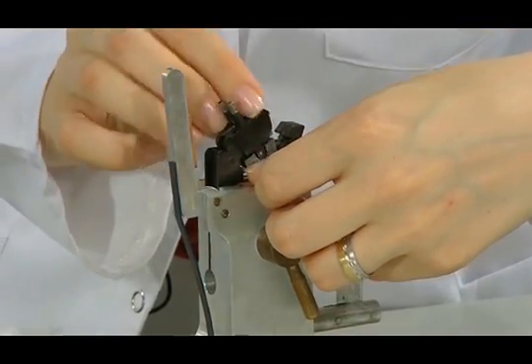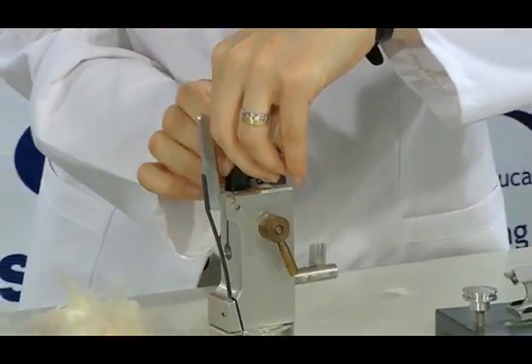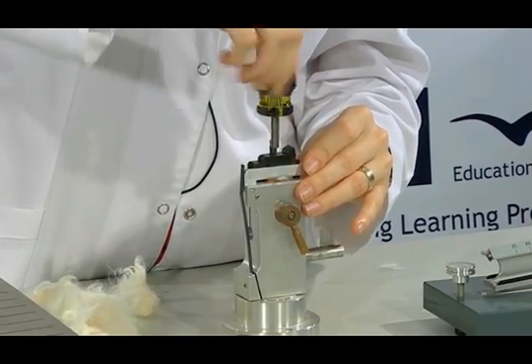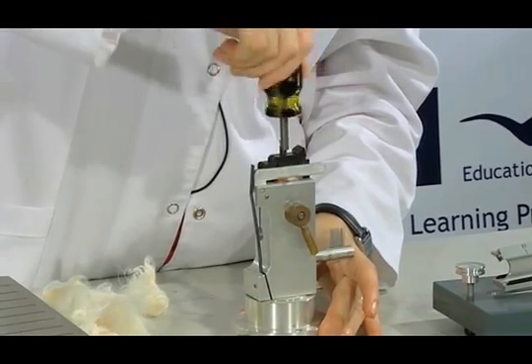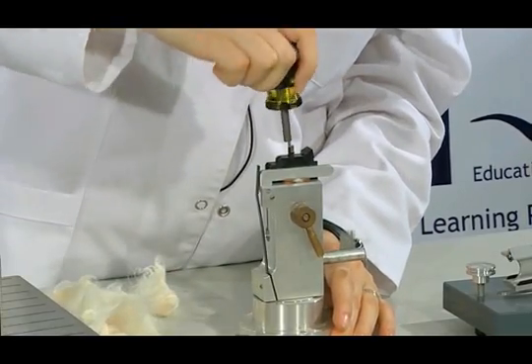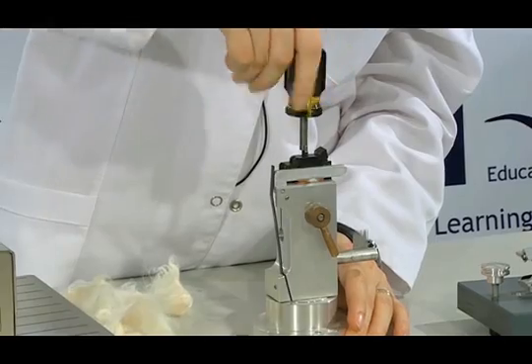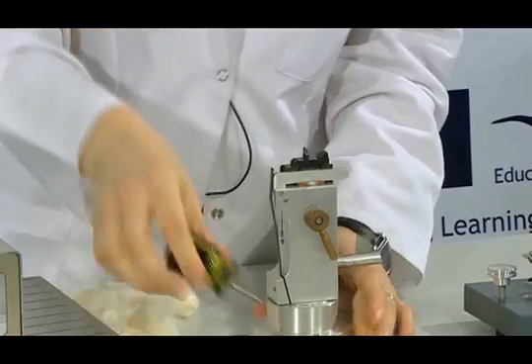And we can now place the fibre. The nippers are closed. And then this handle is lowered down. We squeeze the nippers firmly. We hold the bottom part with our hands. We squeeze the screw until the bottom part turns. We see it is turning and our screws are completely squeezed.